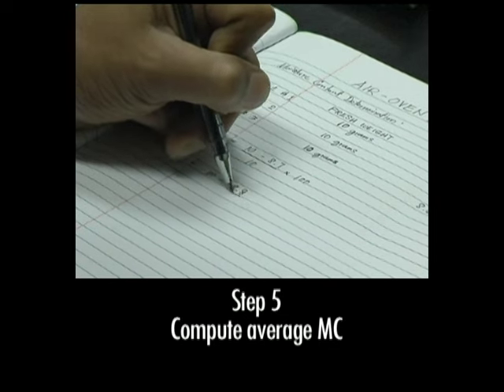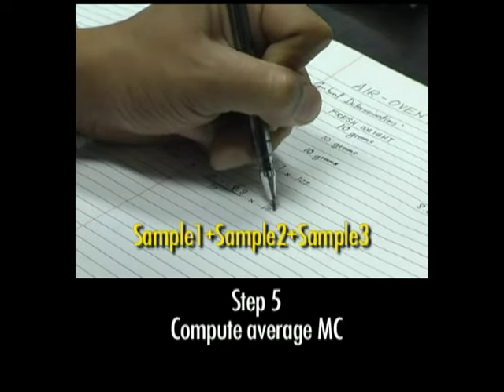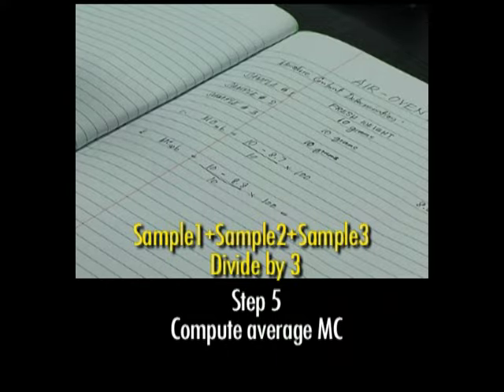Step 5. Compute the average moisture content of the 3 samples by adding the calculated moisture content of each sample together and dividing it by 3.